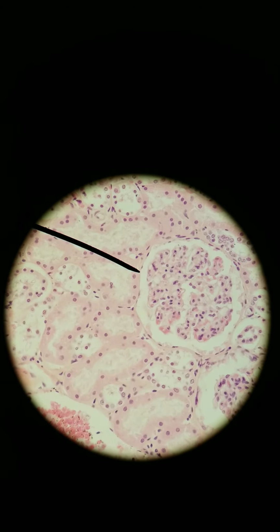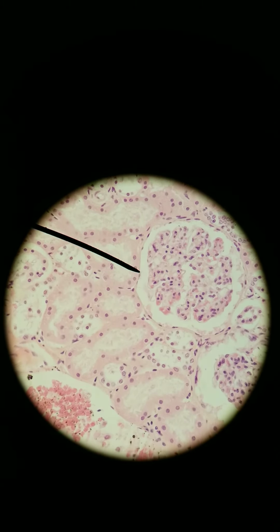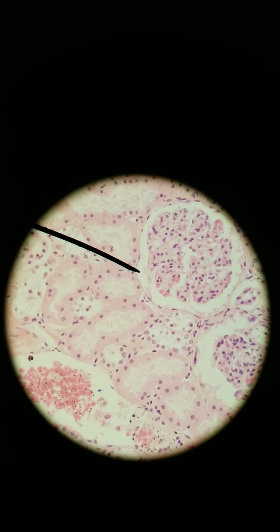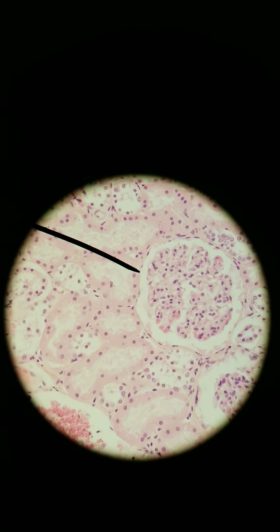This type of cell is what's surrounding this entire circular structure. It's called the Bowman's capsule. It's found in the kidney. It's what catches all the filtrate from blood, but we'll get to that later. This is a very thin, simple squamous cell. And a bunch of these cells, as you can hopefully see, I can't point it out easily, are surrounding that entire circular area. That's a squamous cell, cross-section versus longitudinal section.